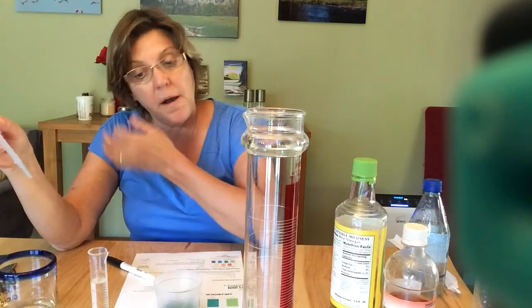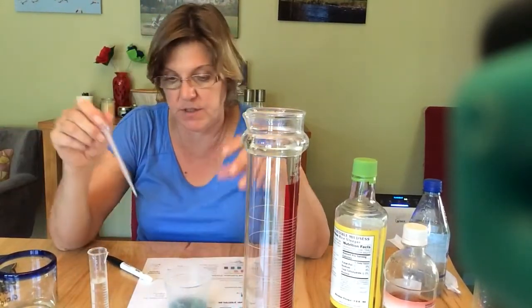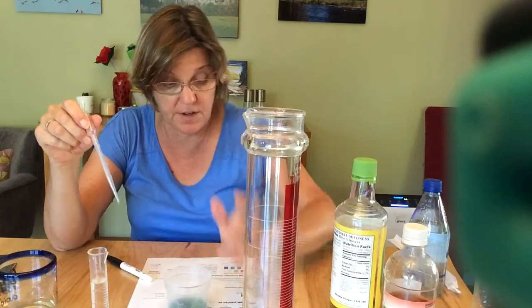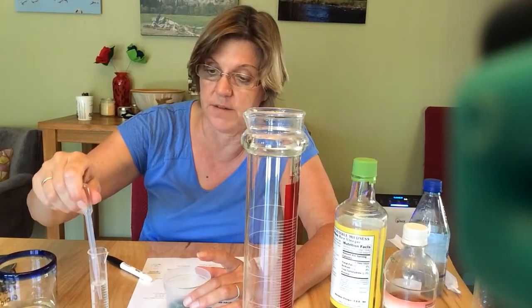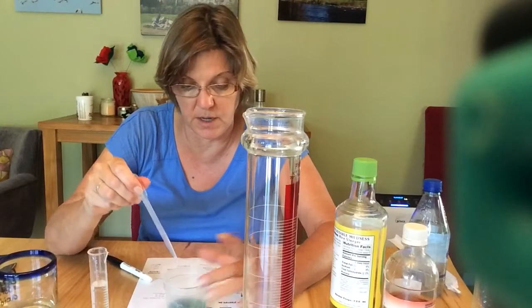What you want to do is get several points. You're going to take the pH all the way down to, let's say, 5, or between 5 and 4, and see how much acid it takes to do that. So I'm just going to add a couple drops.